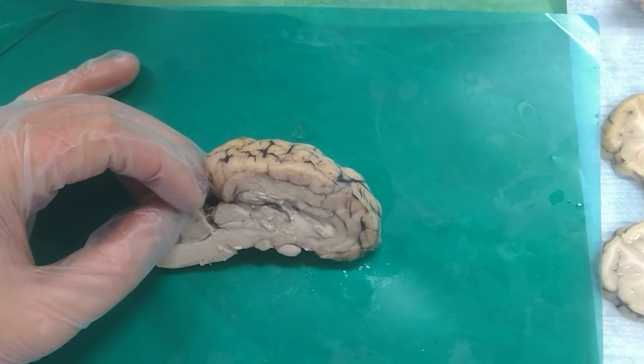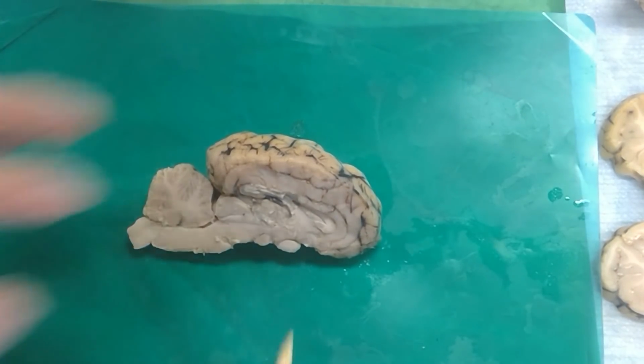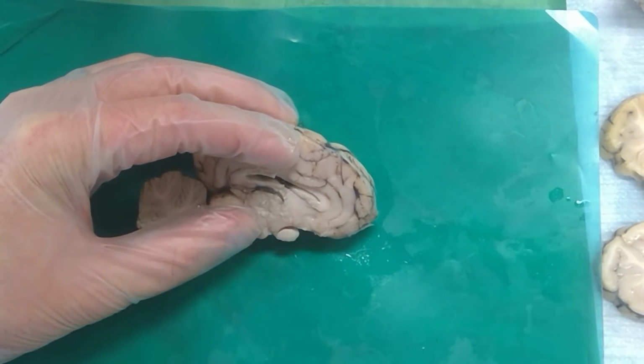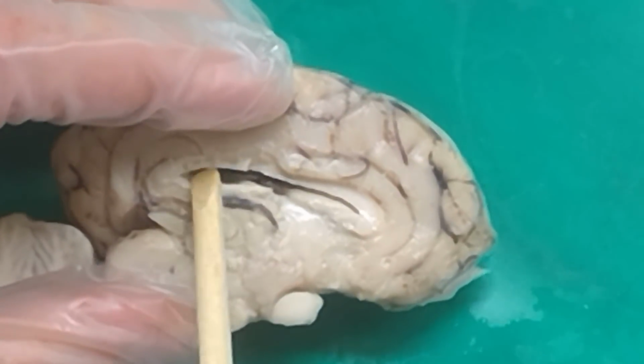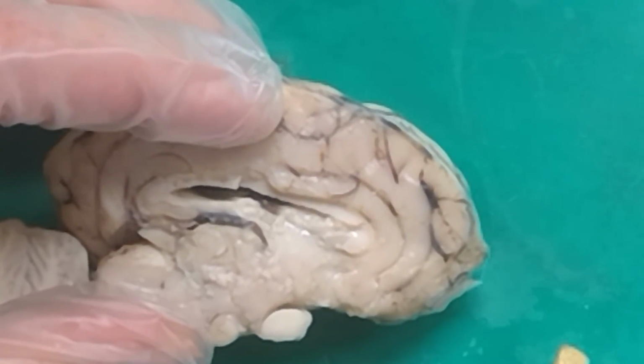All right, should we do, wait, other question? This whole thing right here is the lateral. Oh. Yeah. Oh boy. It's so big and blurry. Any other questions on this?